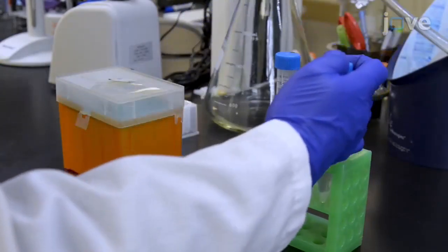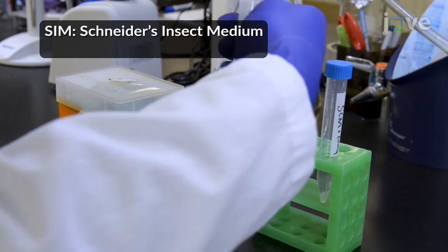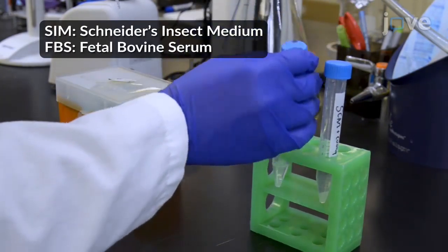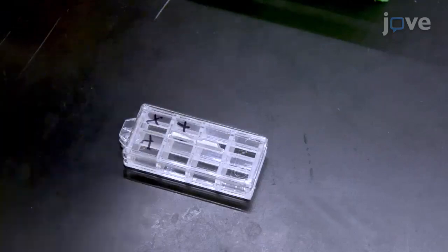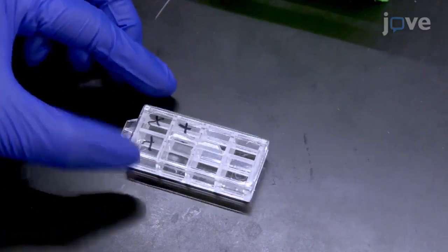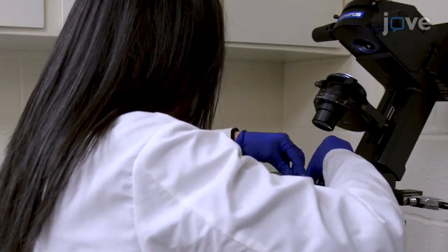Resuspend the pellet in fresh 25 degrees Celsius warmed SIM supplemented with 10% FBS at a 2 × 10⁶ cells per milliliter concentration, and treat the cells with additional 500 micromolar copper sulfate. Then add 200 to 500 microliters of cells to one well of a multi-well live cell chamber and place the chamber on an inverted fluorescent microscope stage.